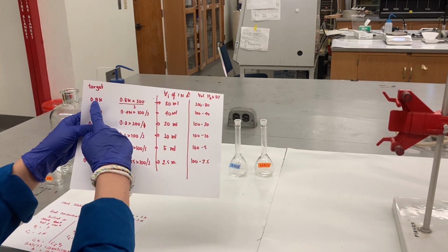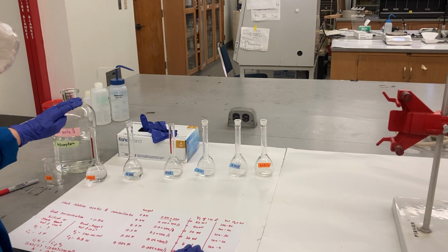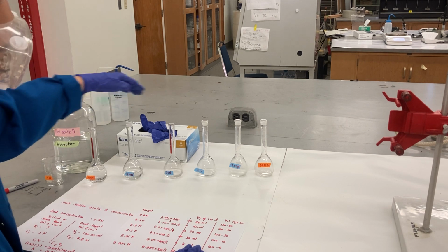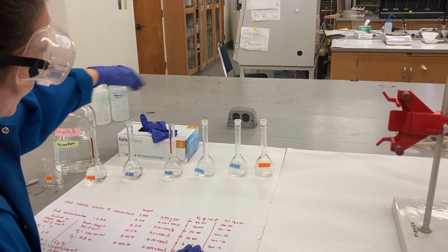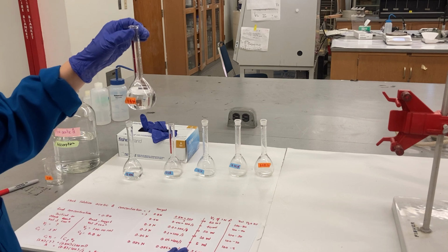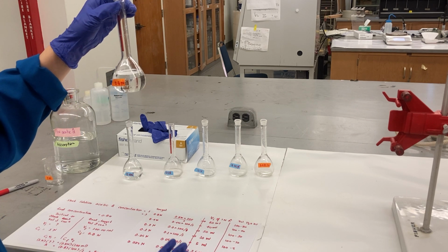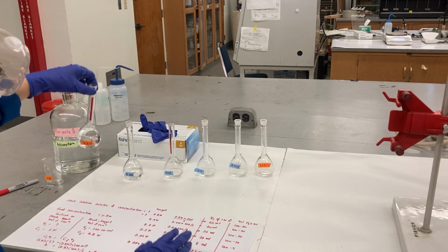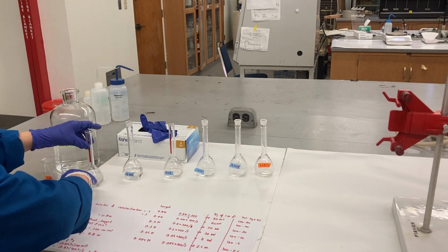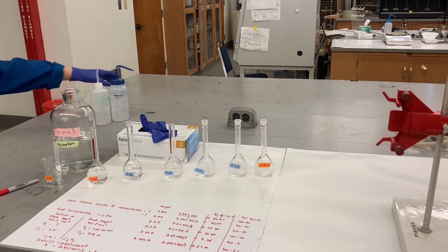Now you did the calculation, and from here you get 80, 40, 20. If you want the final concentration of 0.8, you need 80 of 1 normal. So I put 80 milliliters into here. I put 40 of 1 normal into here. I pipetted them all, getting ready for you already. This container, which we call a volumetric flask, is a flask that we use to do the dilution because it's very accurate. The volume of all of them here is identical, 100 milliliters. I have the 1 normal acetic acid solution in each of them already.